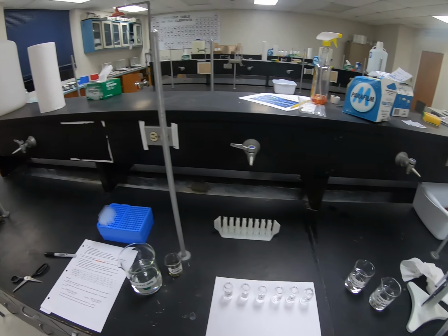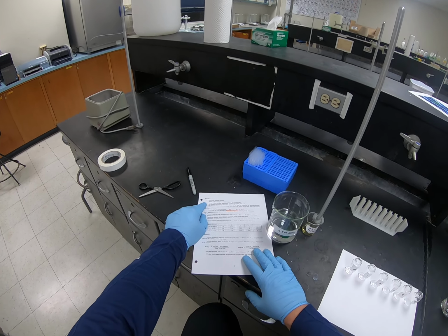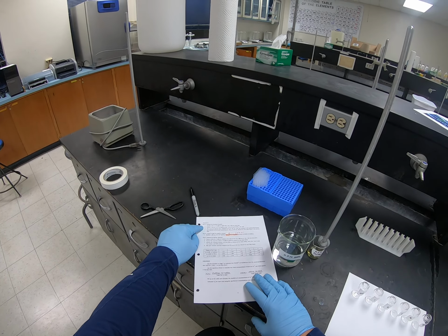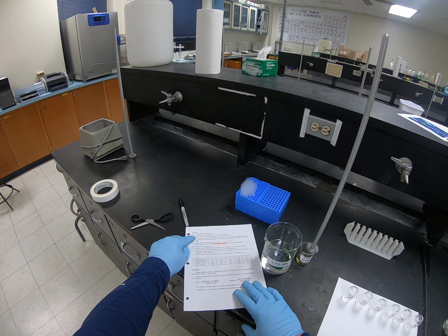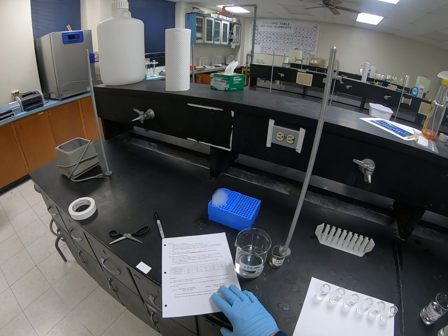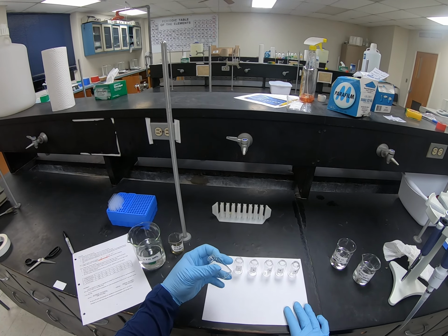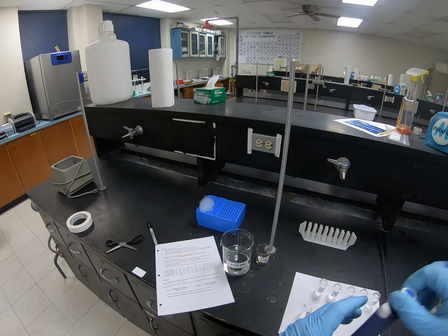So going to the instructions, the first thing I need to do is make this standard. I'm trying to get an idea if the camera's pointed in the right direction. I'm going to be at part A. So I need to mix 1/2 ml of the 0.002 hydrogen thiocyanate. And I don't have any test tubes in my lab upstairs, so I'm going to mix these in a small vial. These are 20 ml vials, and one is marked standard.